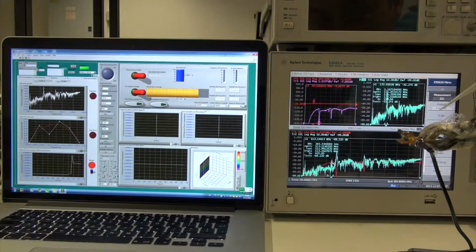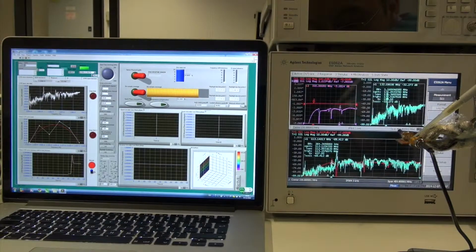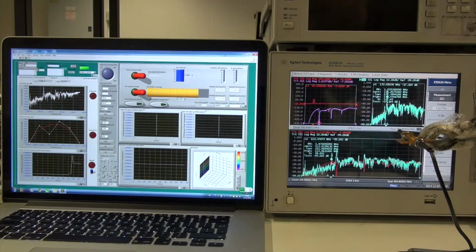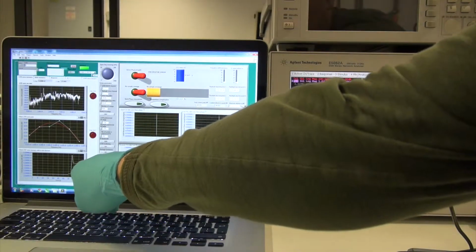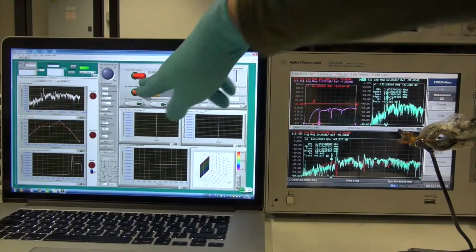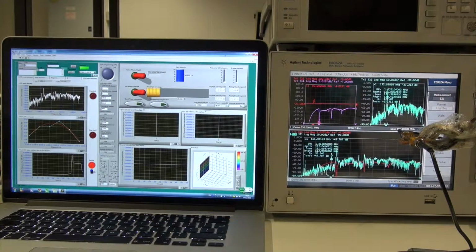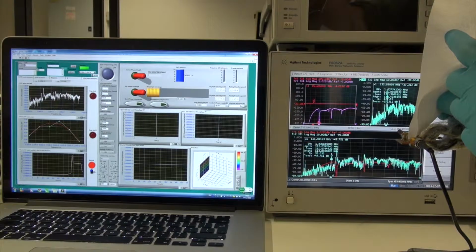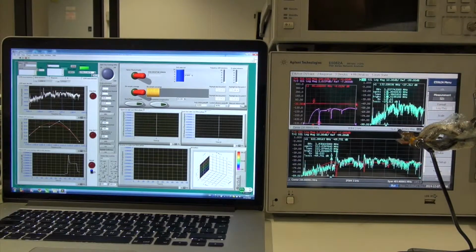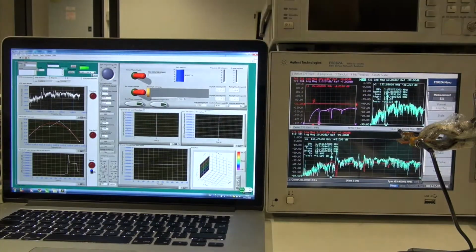Now if we remove the liquid, you can see from the Love wave resonance signal here that the liquid has been removed, and the surface coverage also tells us the liquid has been removed from the surface. We use tissues to clean it thoroughly. Then we can see a further recovery of the surface.